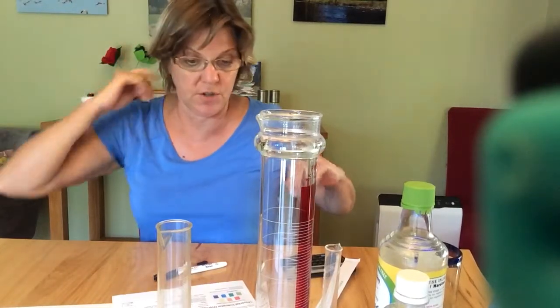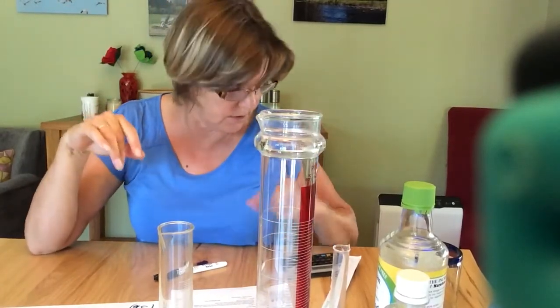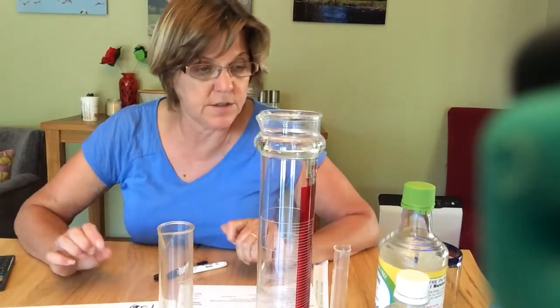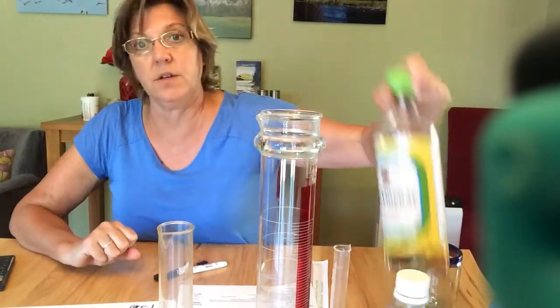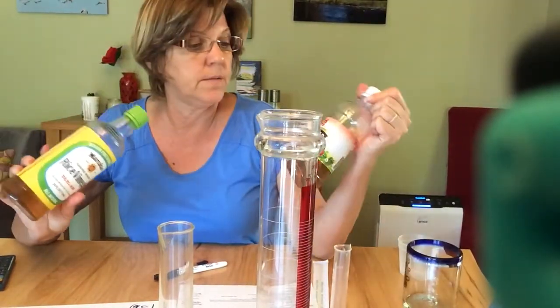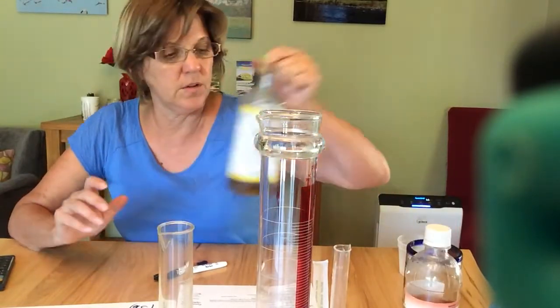Okay, so I'm going to show you how to do this lab, this acid rain lab. I have everything out here that I think I need. The first thing you're going to need to do is create your acid rain. To do that you're going to use acetic acid. You can use rice vinegar, white vinegar, or apple cider vinegar. Balsamic won't really work because it's too dark.